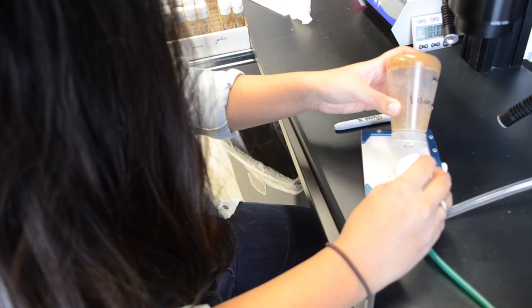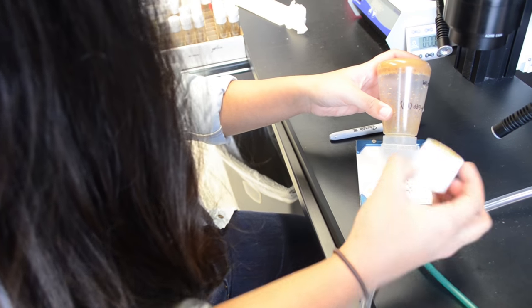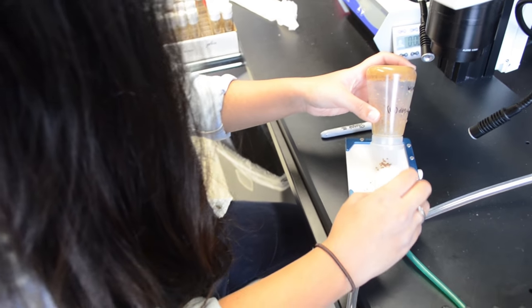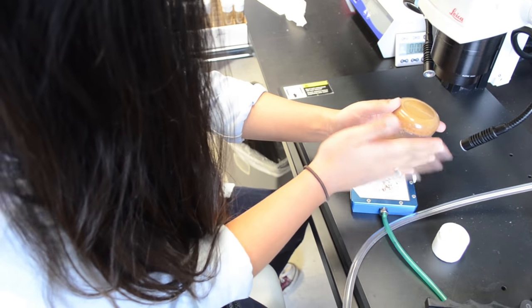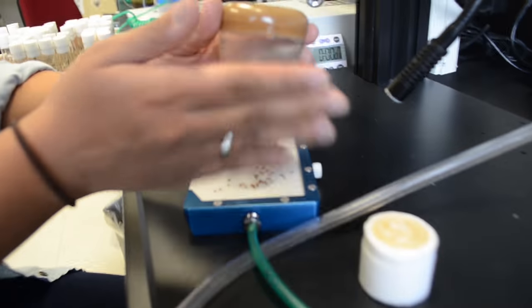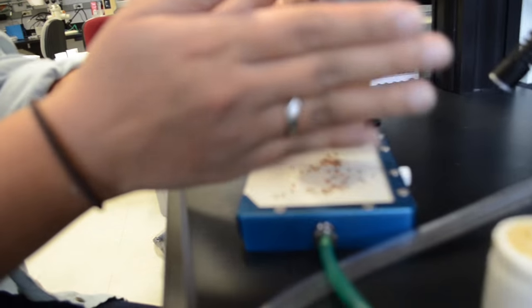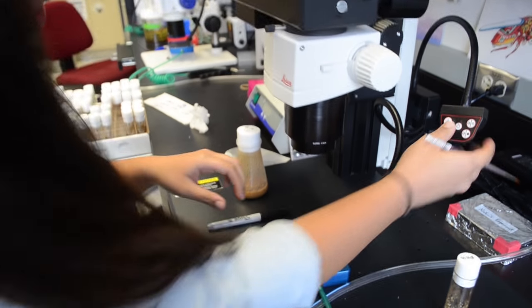This is a fly pad, which also emits CO2 so that the flies stay knocked out even when they're on the pad. We just use a paintbrush to move them around so we can see what's happening.